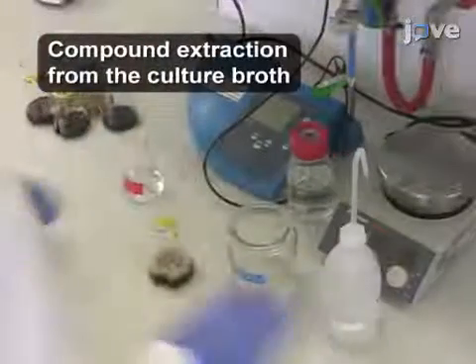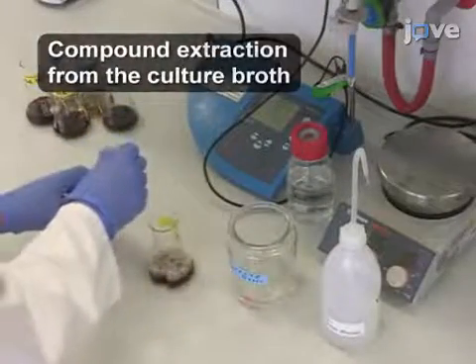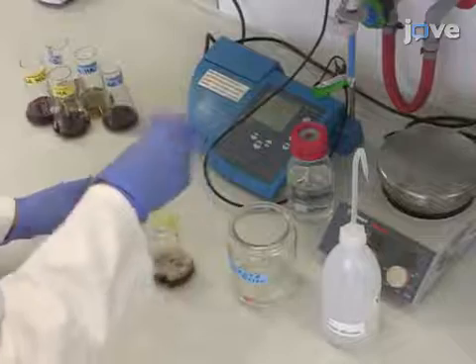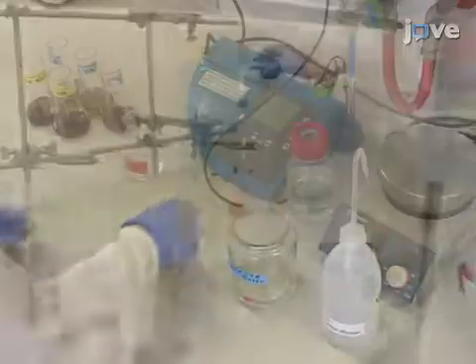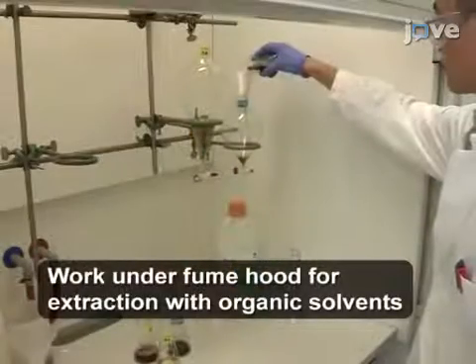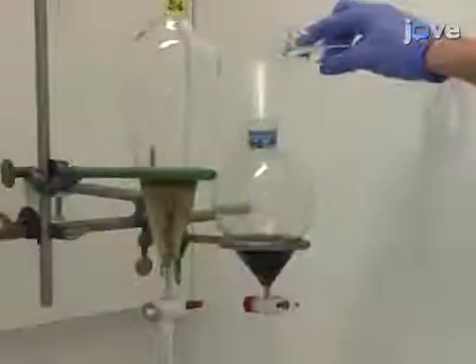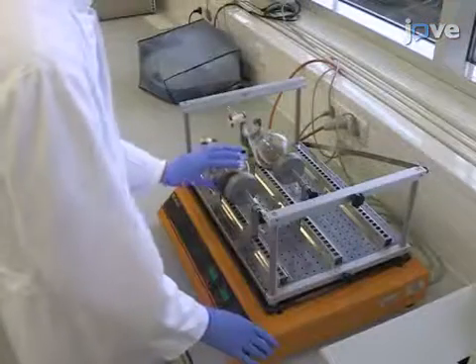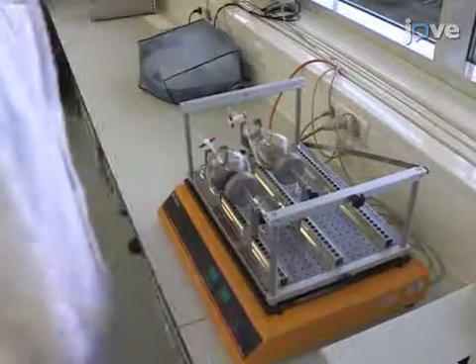For compound extraction from the culture broth, adjust the supernatant to pH 4 by the addition of 1 molar hydrochloric acid, and transfer it into a separating funnel. Then add the same volume of ethyl acetate and shake the mixture for 30 minutes at 180 RPM.